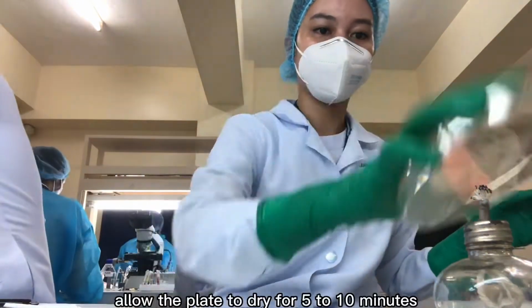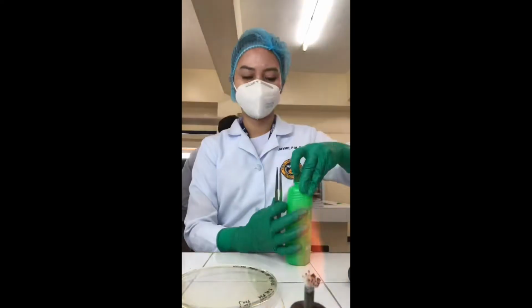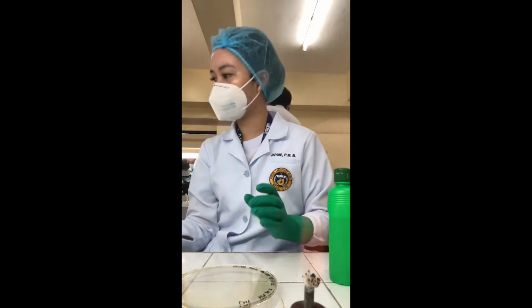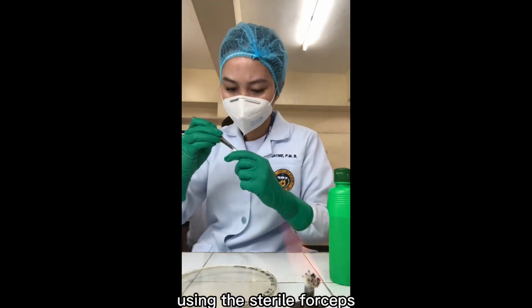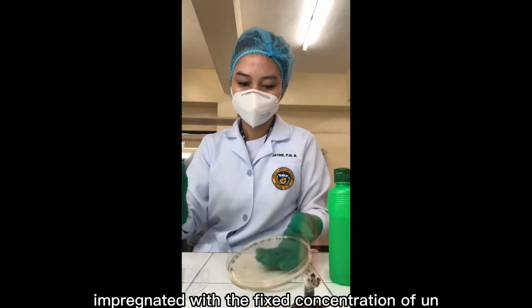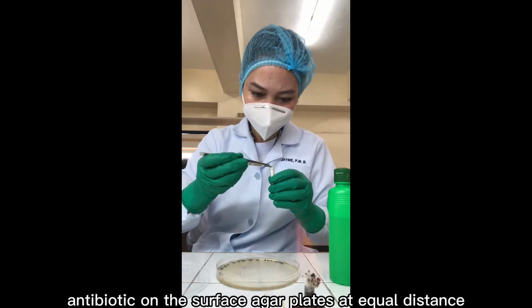Allow the plate to dry for 5 to 10 minutes. Using sterile forceps, place paper discs impregnated with a fixed concentration of an antibiotic on the surface of the agar plate at equal distance.